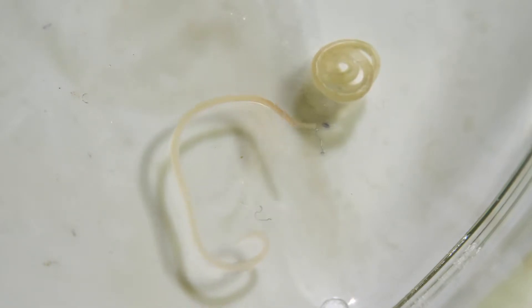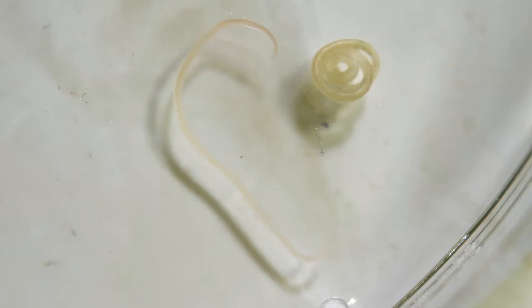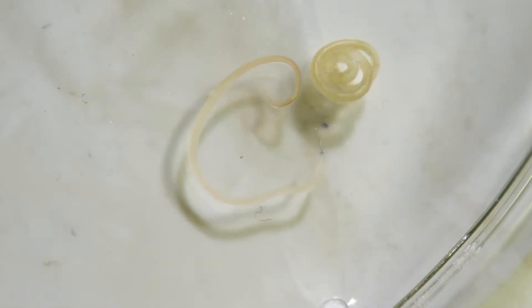These parasites infect mackerel very frequently, but also a number of other food fish species — so cod, herring, anchovies for example. This parasite is potentially infectious to humans, and so that's why I'm wearing gloves and a lab coat.